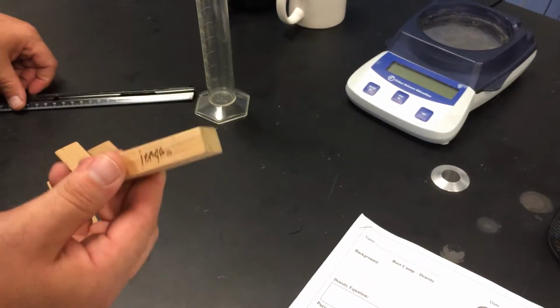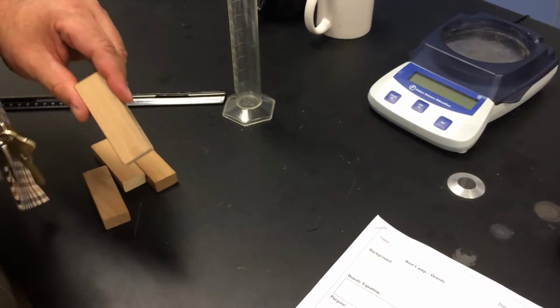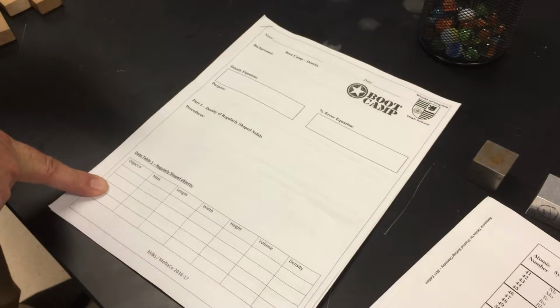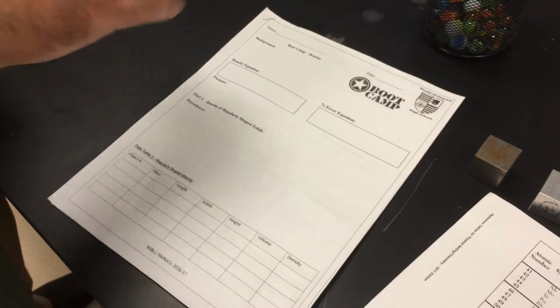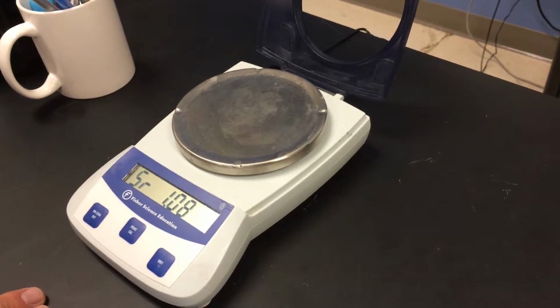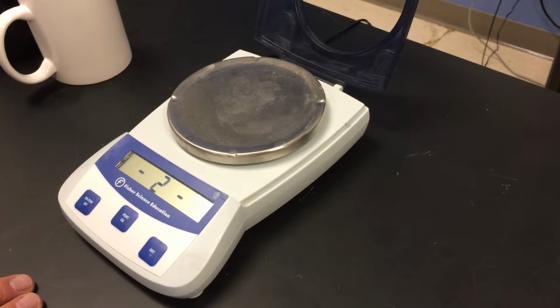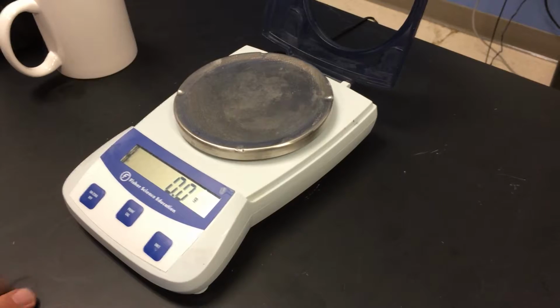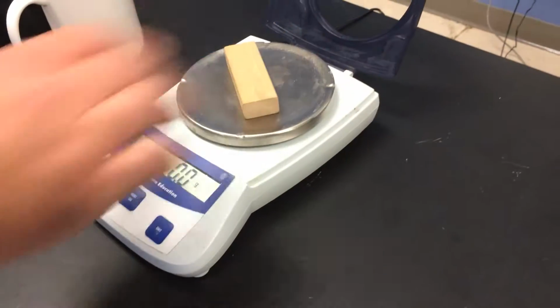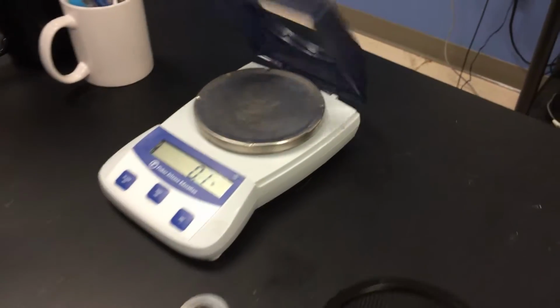We aren't going to make you do three different of these, though. So you do it once, and then your lab partner does it once, and then your other lab partner does it once. That way we can get an average. Then we all know how to mass, right? I'm going to use the scale or the balance. Should be started for you. Make sure it's at 0. If it's not, we zero or tare it. Now we can mass it. I'm not showing you what the mass is. I know better. We're going to fill this out. Let me get an average density of your regularly shaped object. Good?